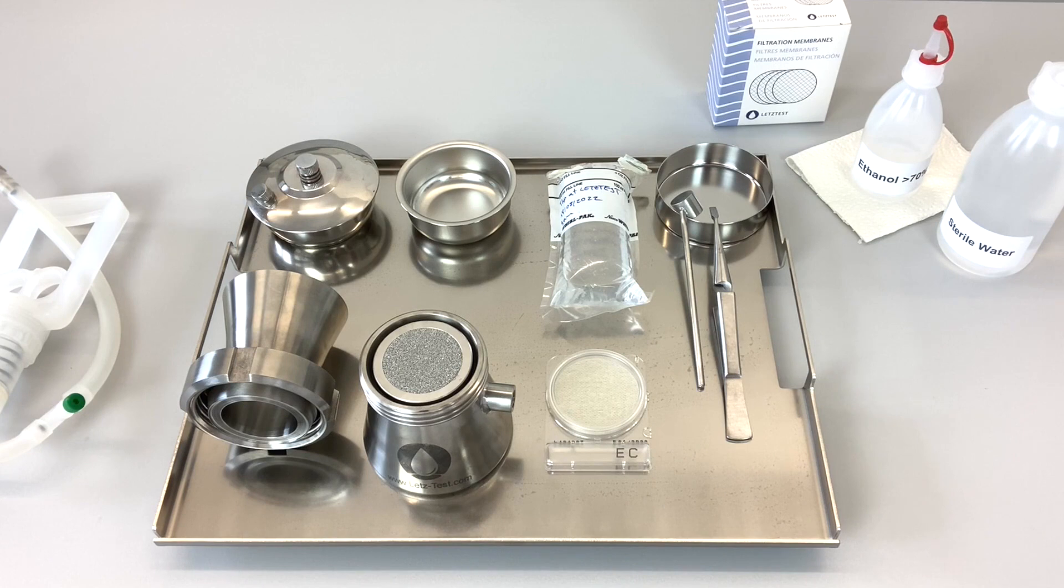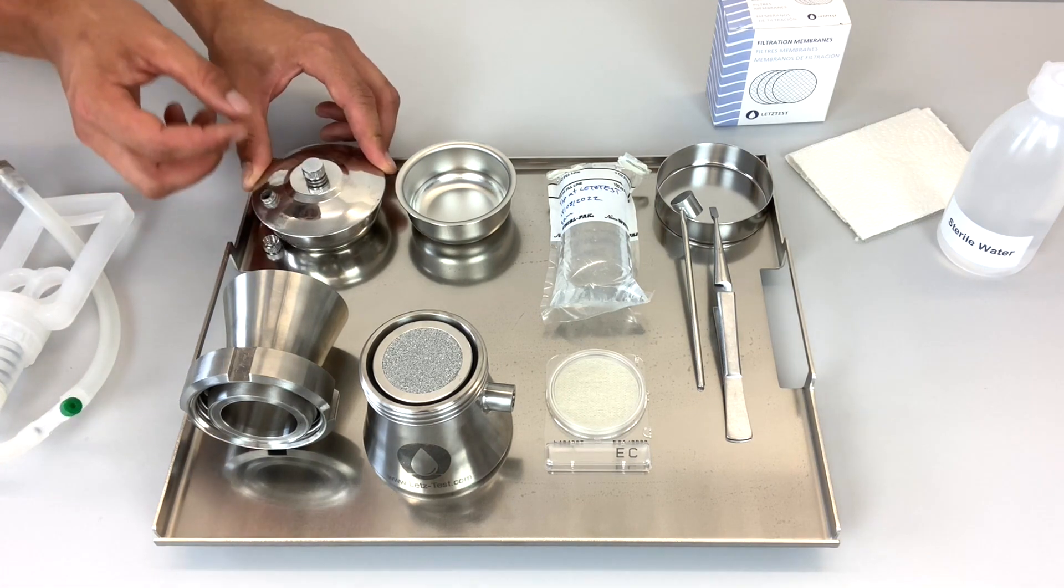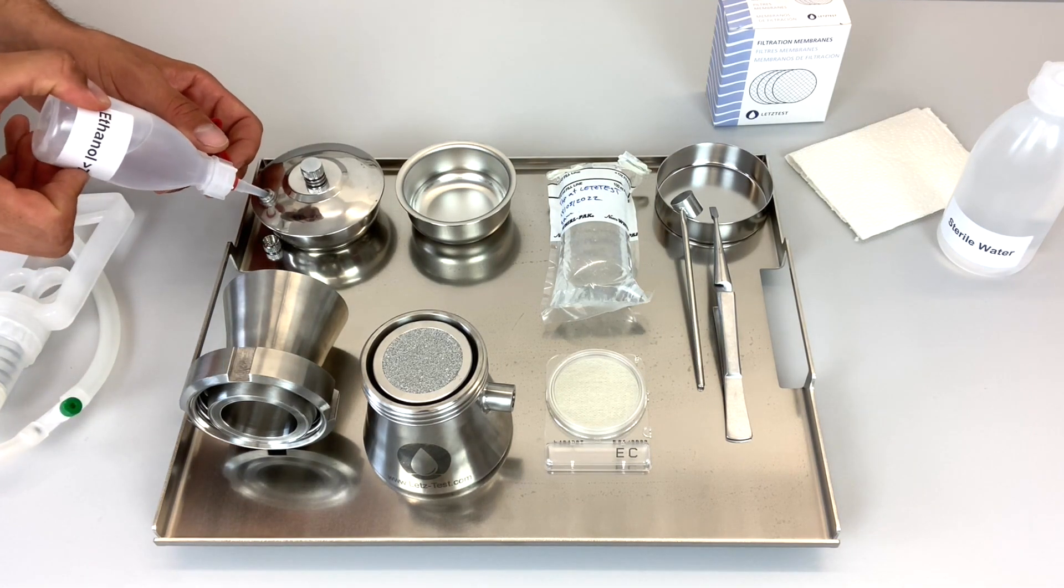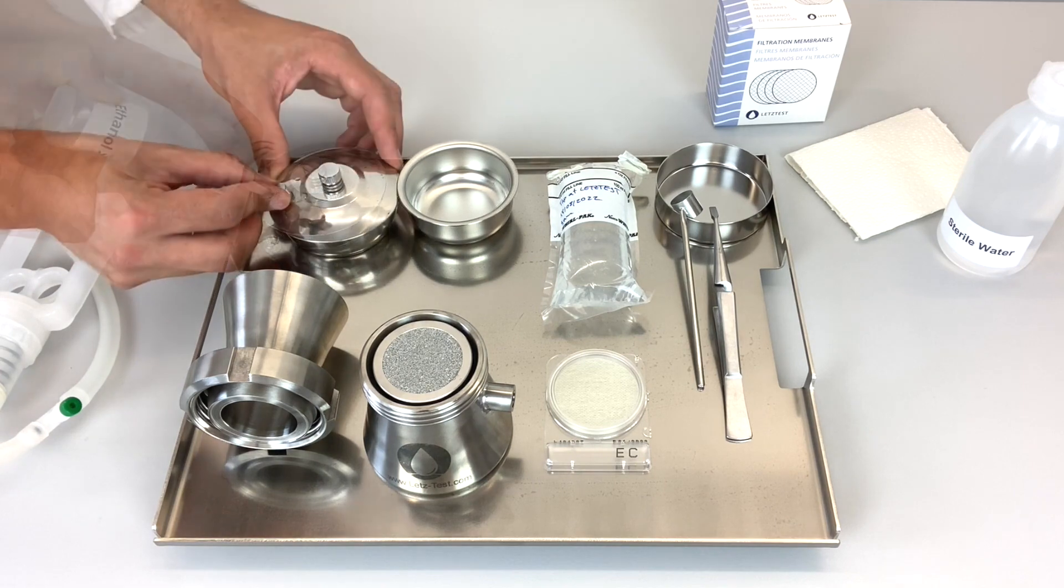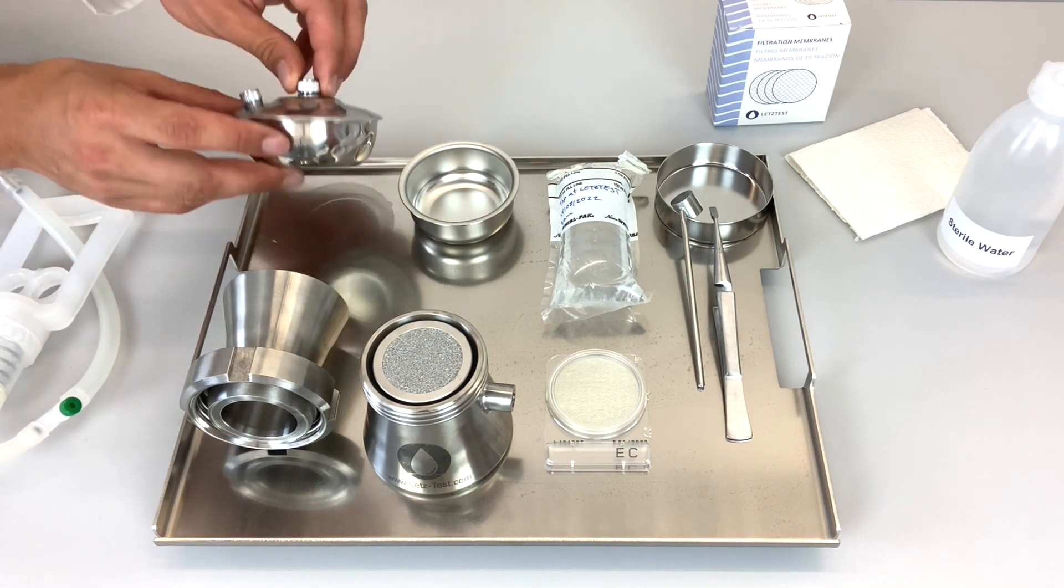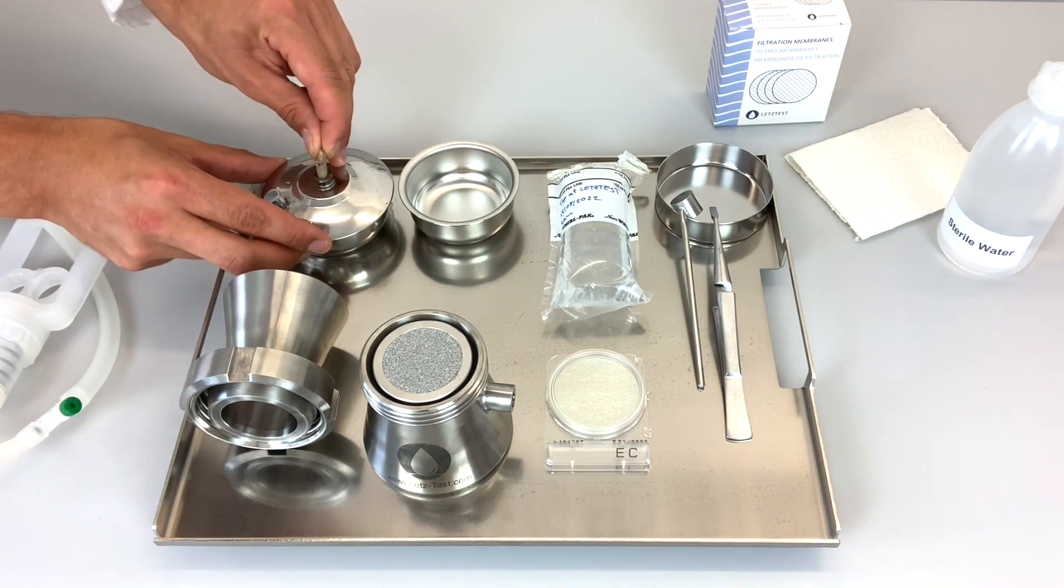Now fill the laboratory candle with alcohol and light it, and pour a little alcohol into the alcohol beaker.